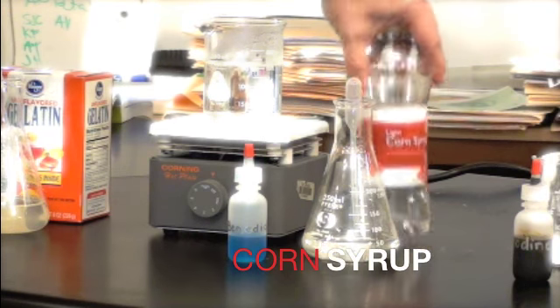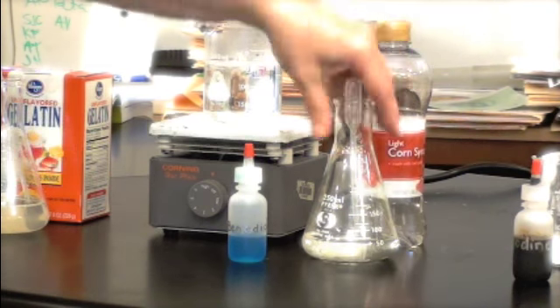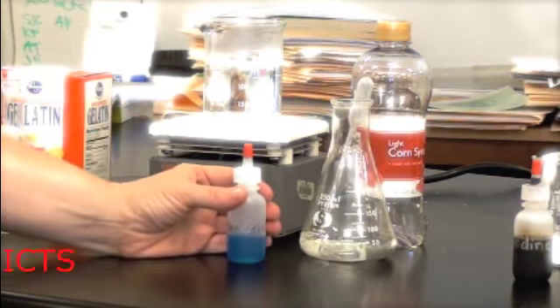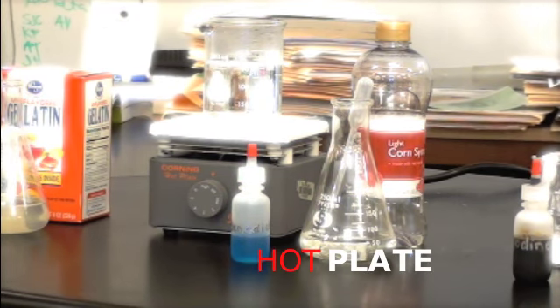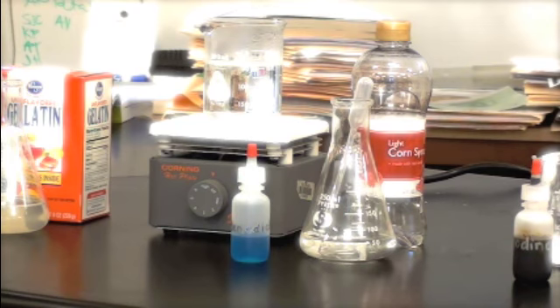Corn syrup, any light or pancake would do. We've diluted a little in water and Benedict's is the reagent. This is why we will need the hot plate. Assume the hot plate is hot until you know that it is not.